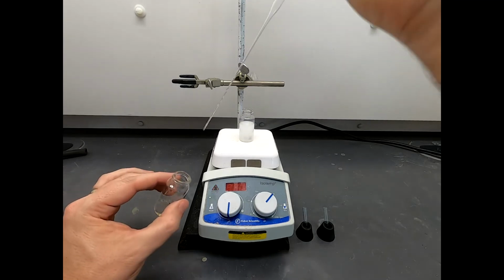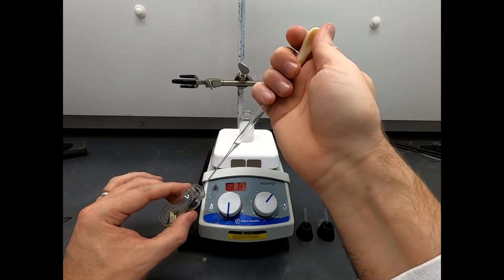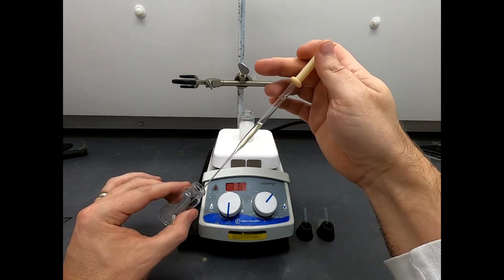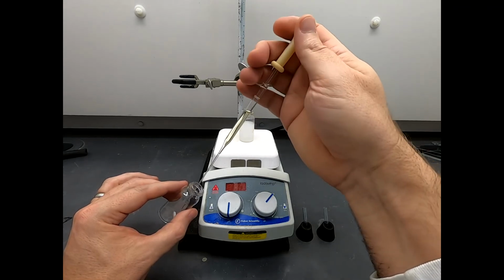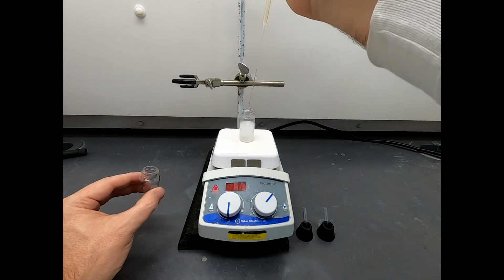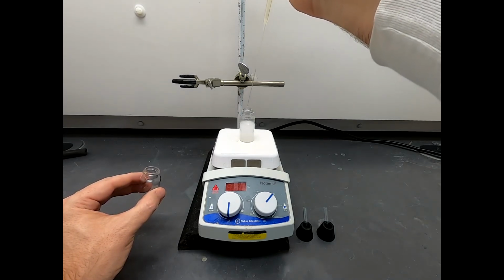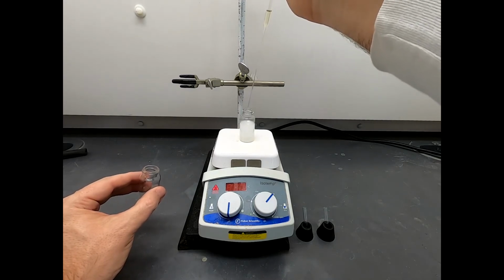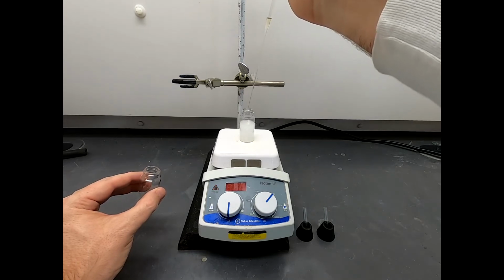And there's one pipette. Let's go for a second pipette. Oh, the cloudiness. That's okay. You know, one thing I'll say, it's nice to see the reaction behave consistently. If it happened to me in the previous reaction, it's at least reproducible. And of course, if it's reproducible, then I have more confidence that the way I fixed it last time, we'll fix it this next time.